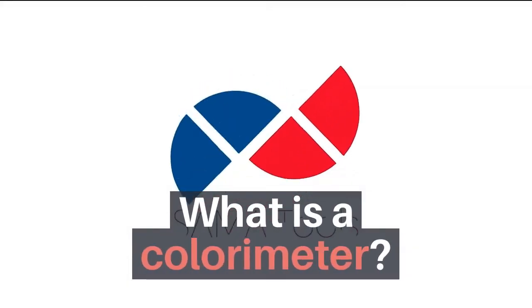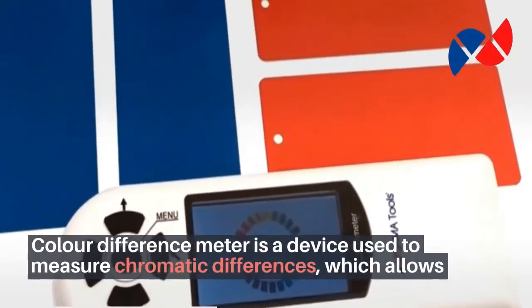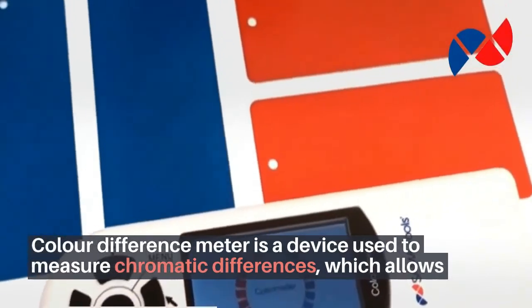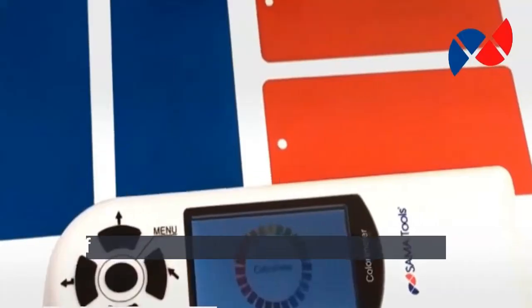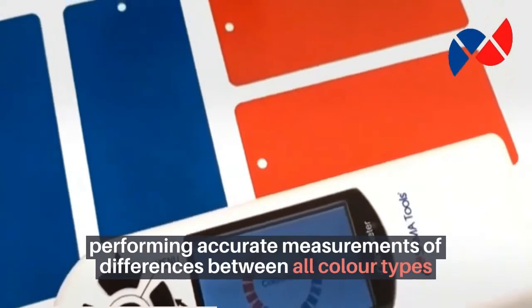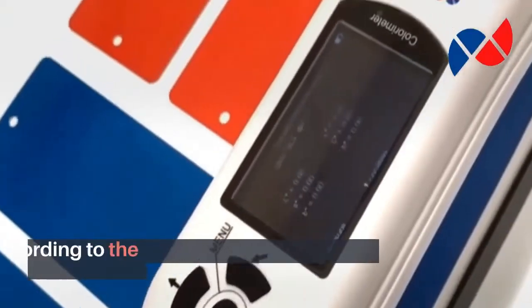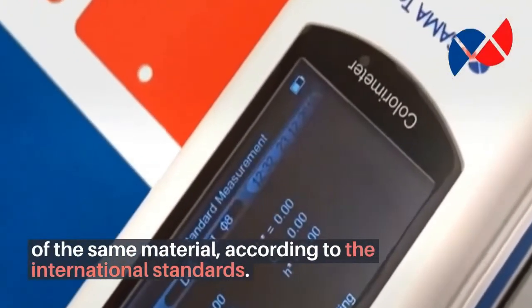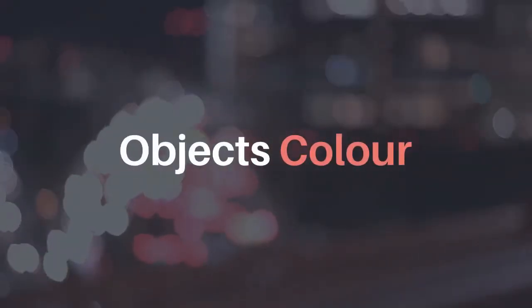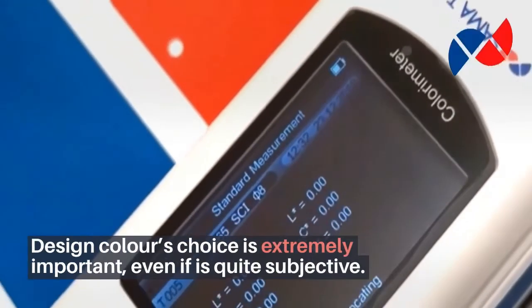A colorimeter or color difference meter is a device used to measure chromatic differences, which allows performing accurate measurements of differences between all color types of the same material, according to international standards.